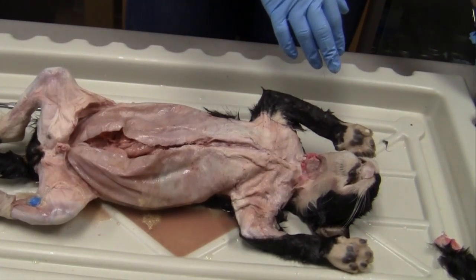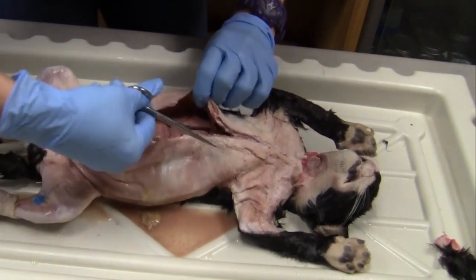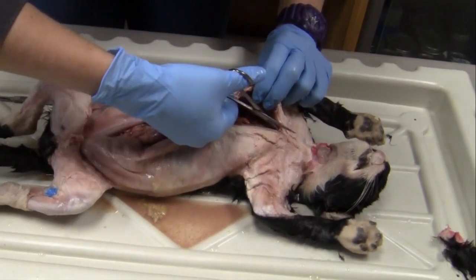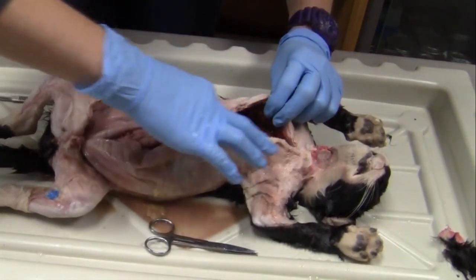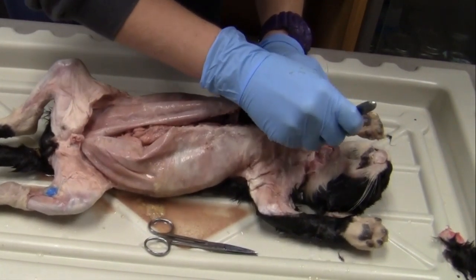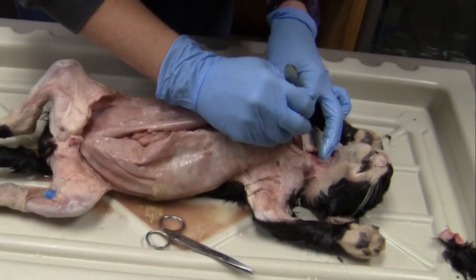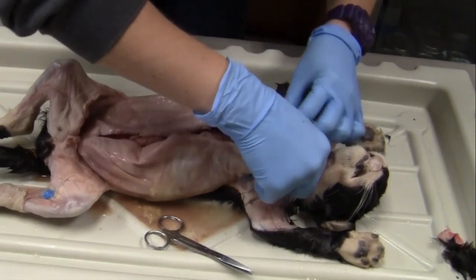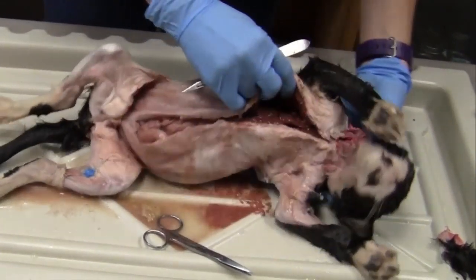Okay, so next, to actually cut up here in the sternum, I'm going to take my scissors and use the scissors, hopefully you guys don't mind bone crunching, to actually cut up here into these bones. Okay, you guys are going to see there's quite a bit of good stuff in here. And I want to be very careful when I'm cutting up here so that I don't cut any arteries or veins that we have up here in the neck. So be pretty careful up here. Okay, so got these separated. I'm going to dump my cat out here again, get some of that fluid out.